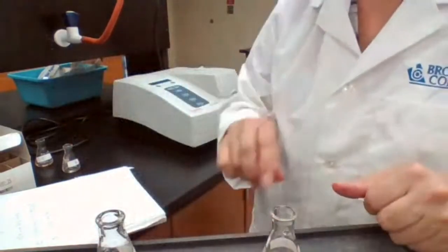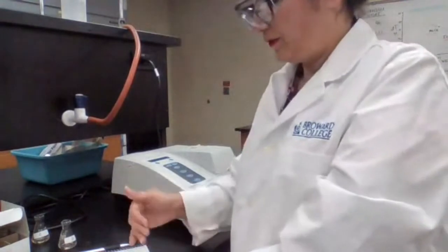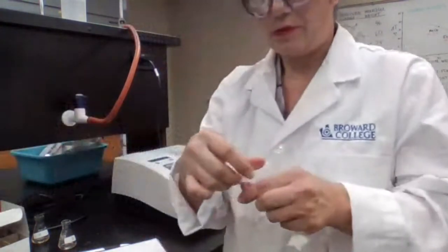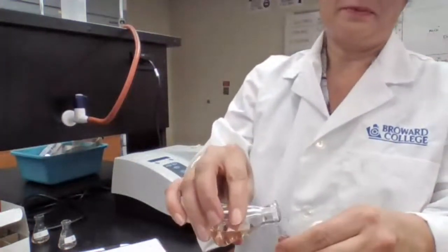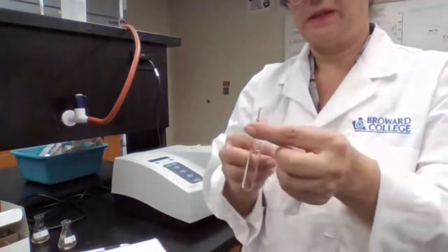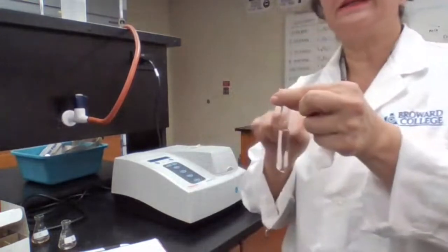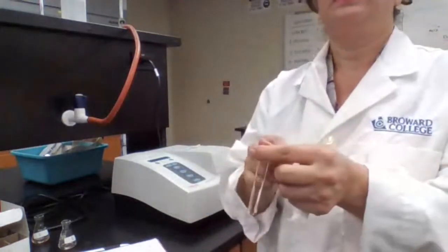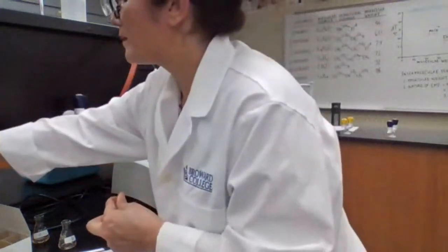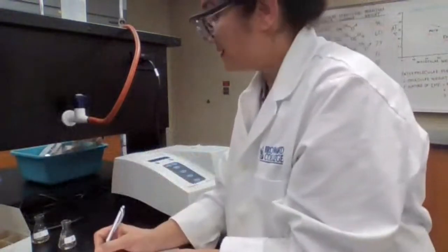Sample D is going in at 2:07. I just have to wait since I don't have other standards to prepare. If the sample is in the test tube or in the flask, it should have the same intensity of color. It's okay to transfer to the cuvette and wait until 2:07. At 2:07 I can read the next sample. Sample D reads 77.3 percent T.